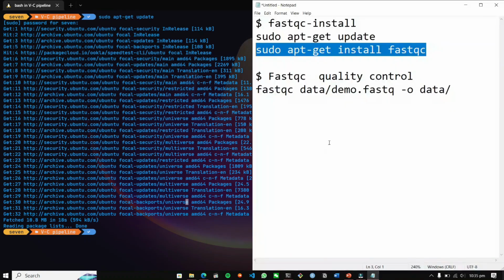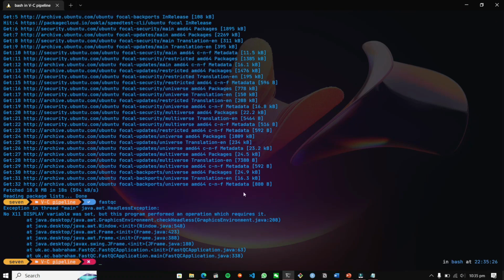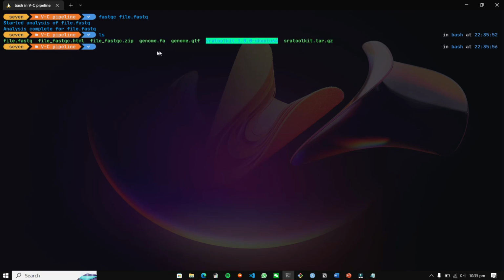Let's see if FastQC is available. I'm just going to type FastQC and see if it is installed. And yes, in this folder I got FastQC. So how do we apply FastQC? Let's just type fastqc file.fastq and create an output. Don't do anything else, just apply FastQC on file.fastq, because we have the file.fastq data, and then the result will be generated.